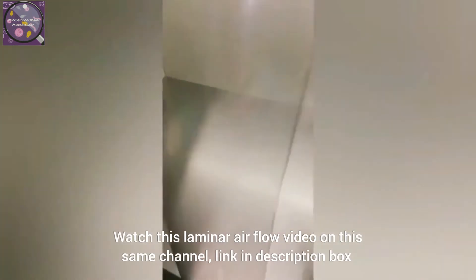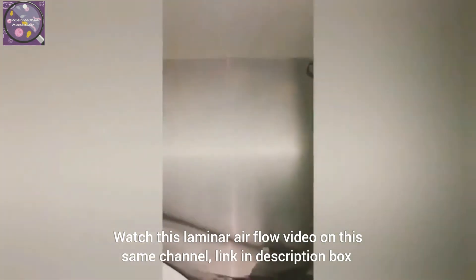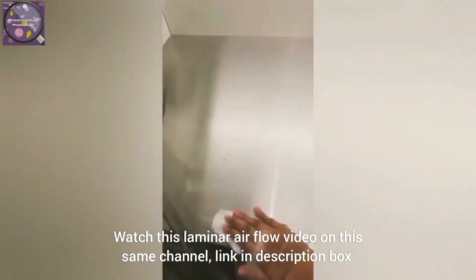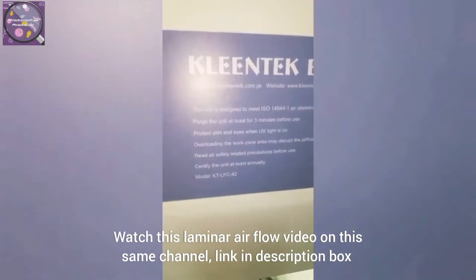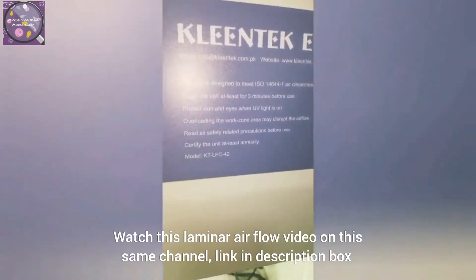Exposure to UV radiation can cause erythema of the skin and eye damage. Ultraviolet lights or lamps are not required in biosafety cabinets. We learned today that laminar airflow cabinets have UVC germicidal lamps.